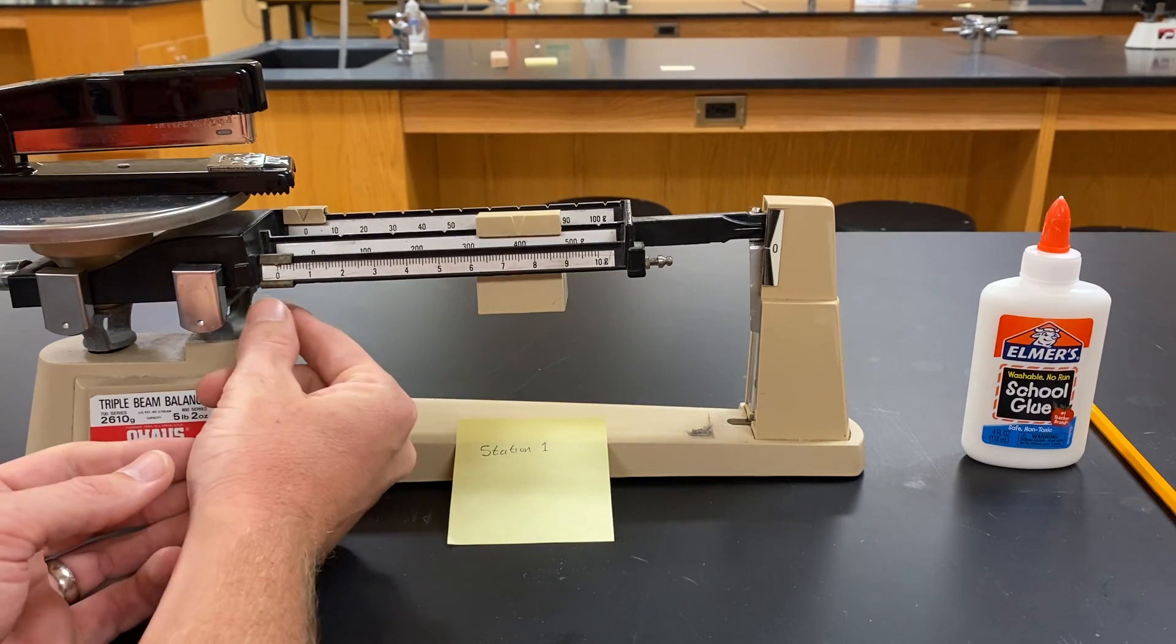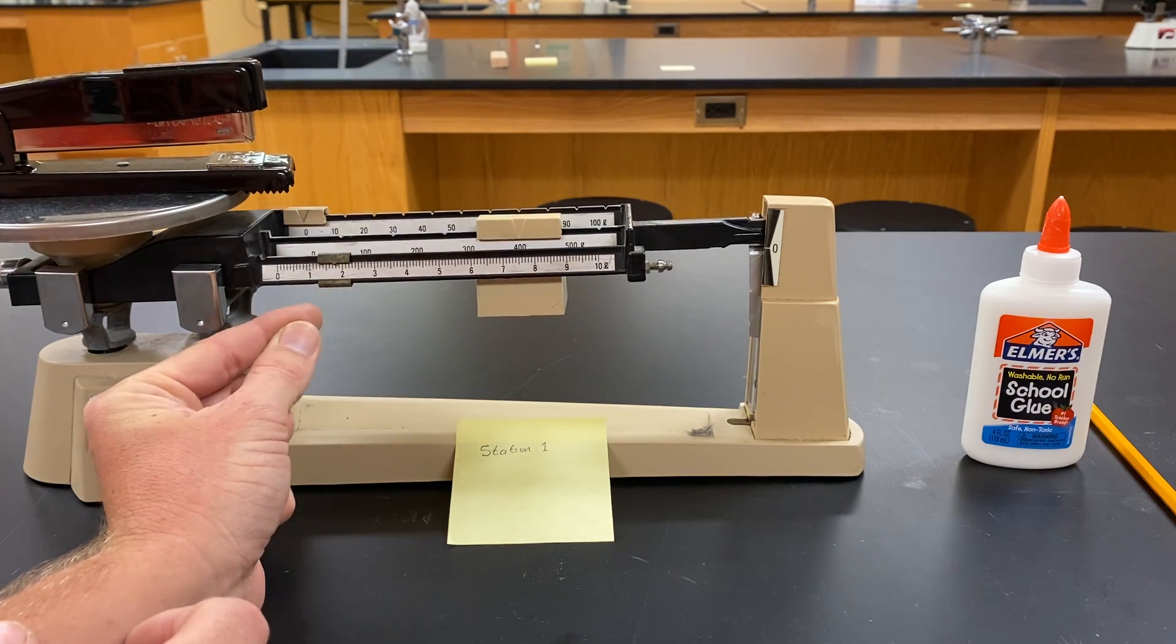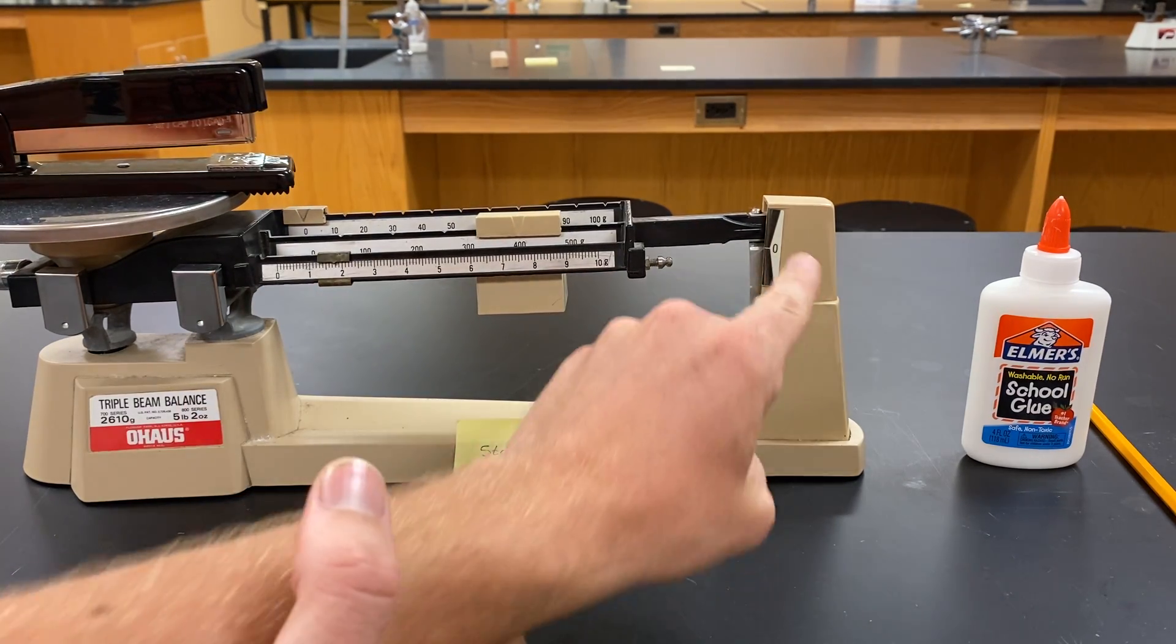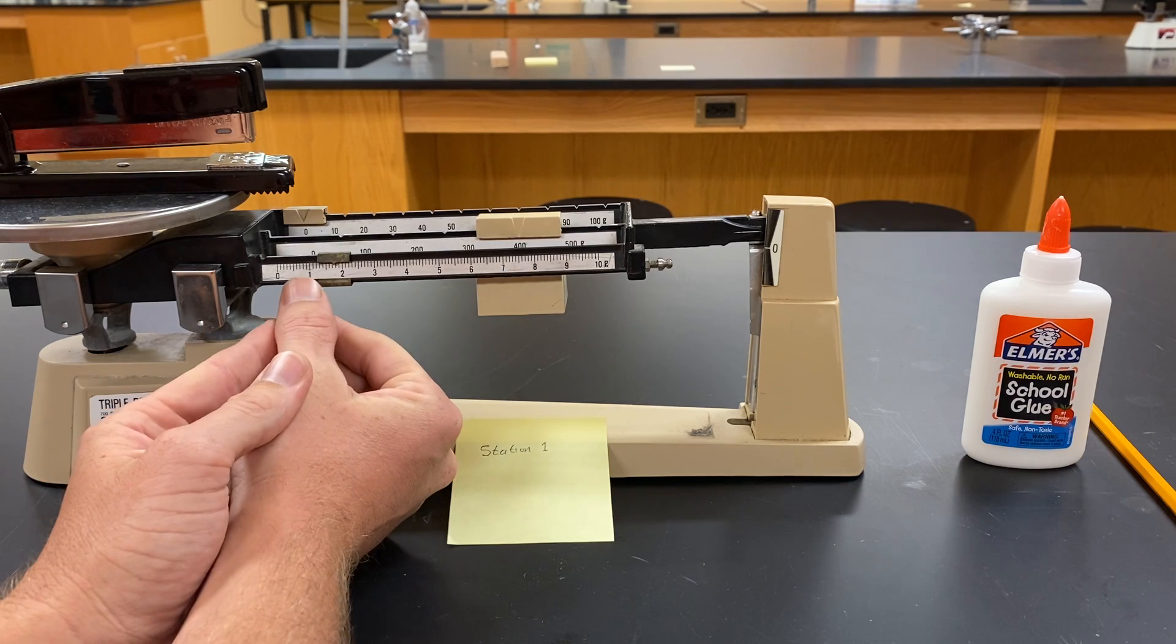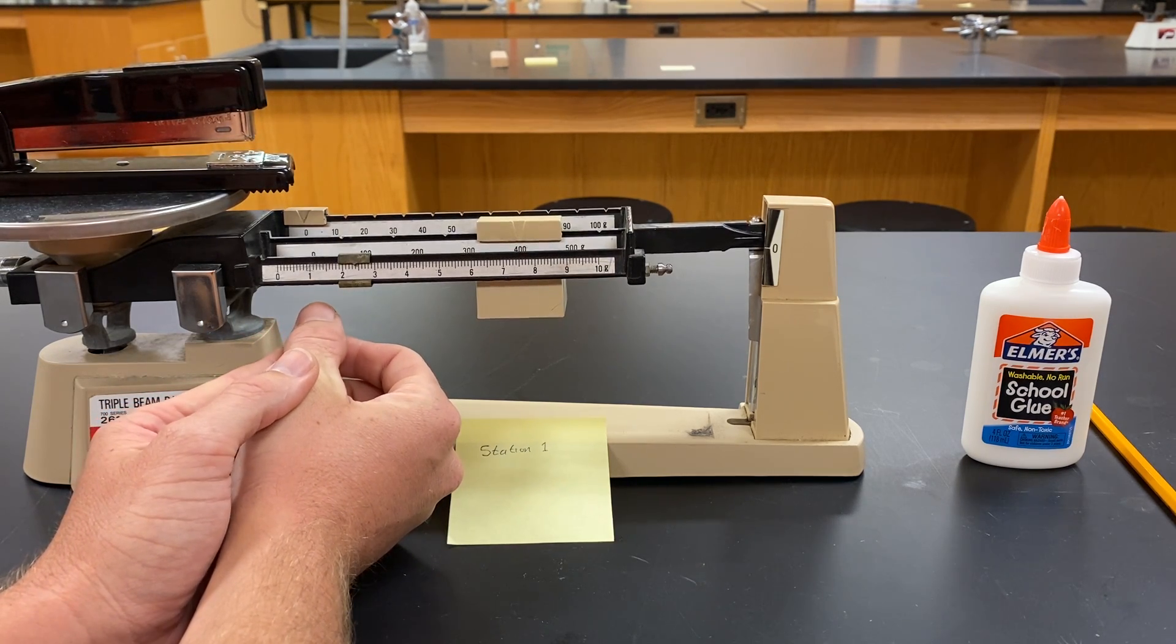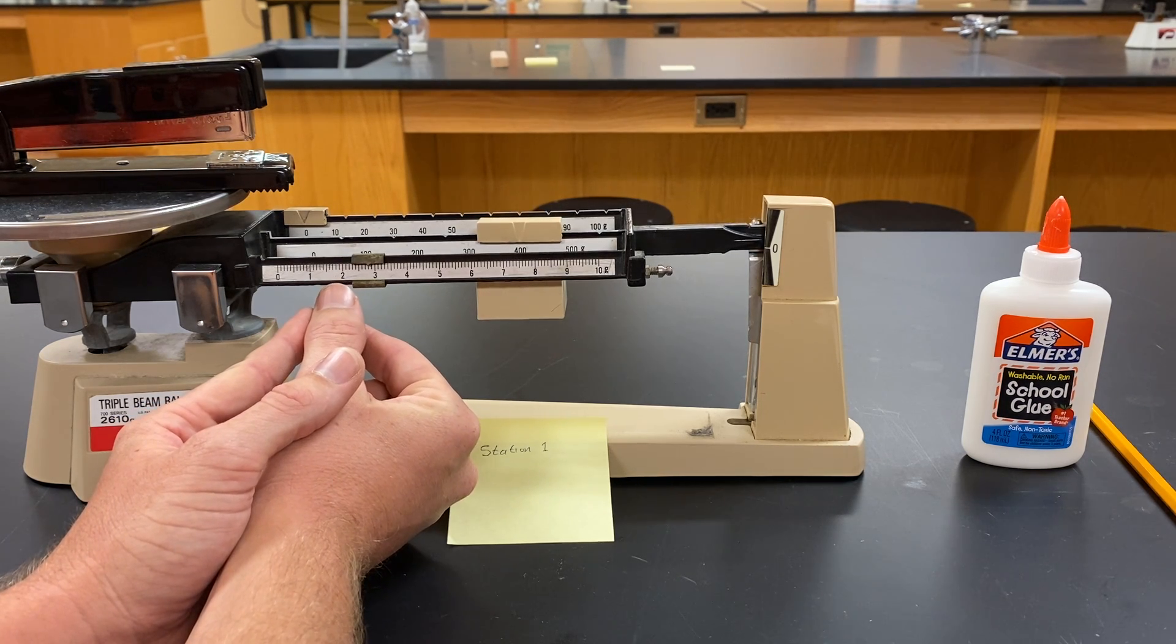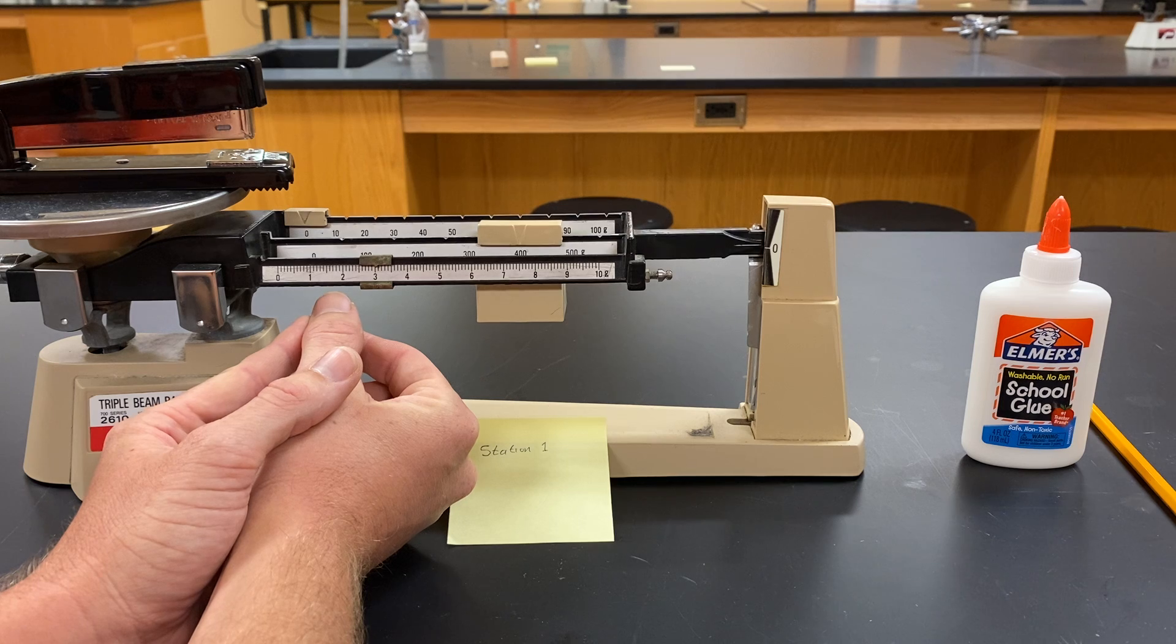Now we're going to move this smallest weight over until we get that white line to match up with the zero. It's all about the light touch here. A little bit past three maybe.